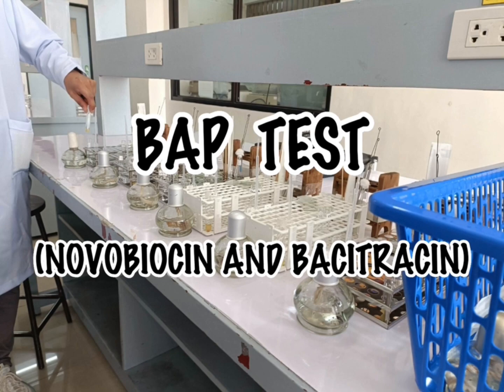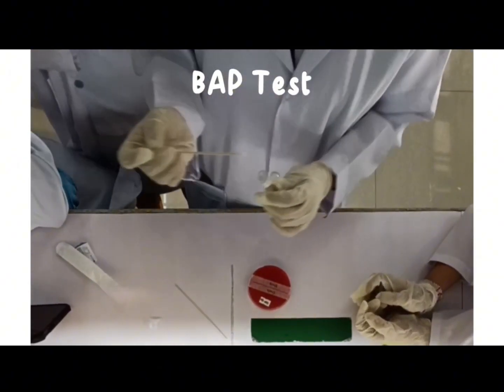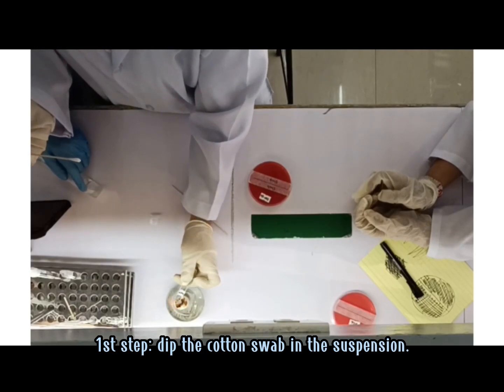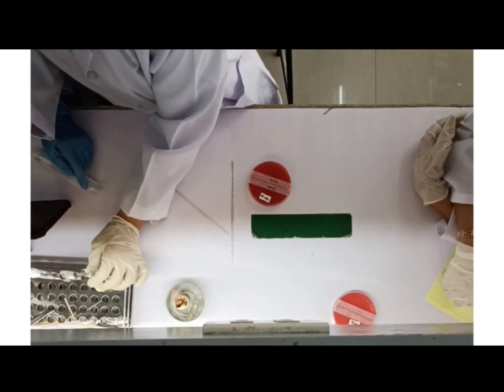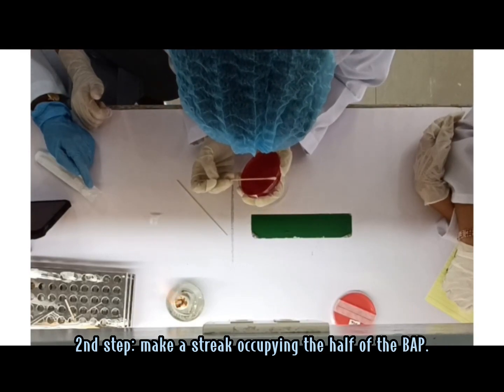To begin the test in our BAP, we will use the bacterial suspension that we made. We will also make a line to separate the streak for Staphylococcus colonies and Streptococcus colonies. We will use a cotton swab and dip it in our suspension of Staphylococcus. Remove the excess liquid by making a circular motion in the tube. After that, we will perform the streaking.